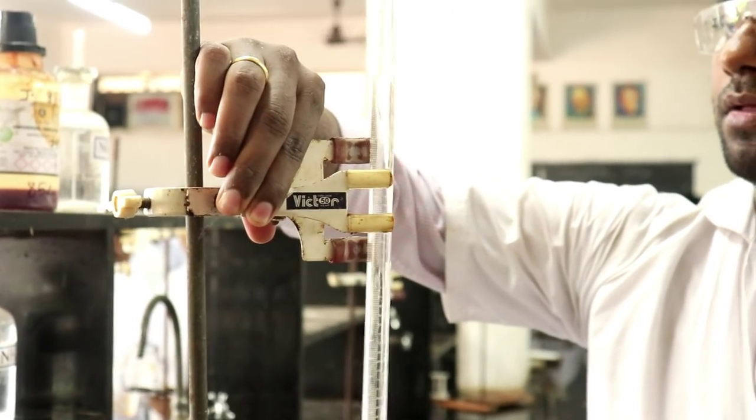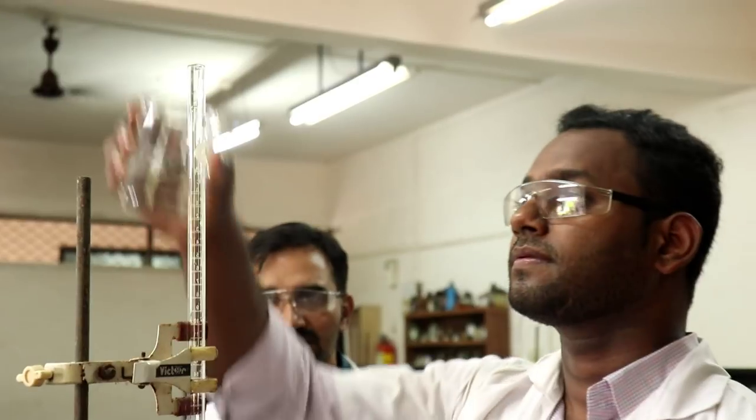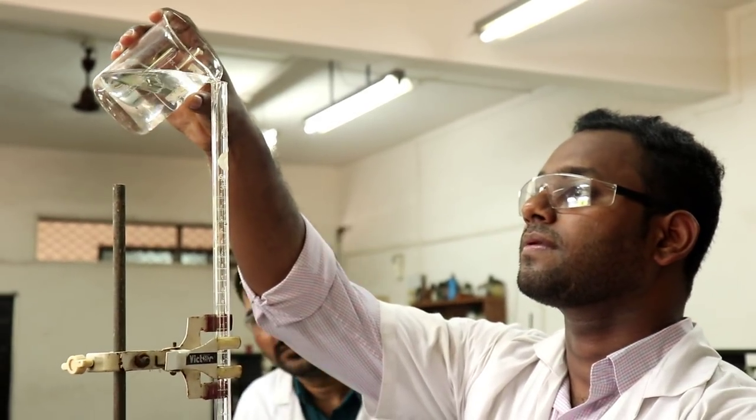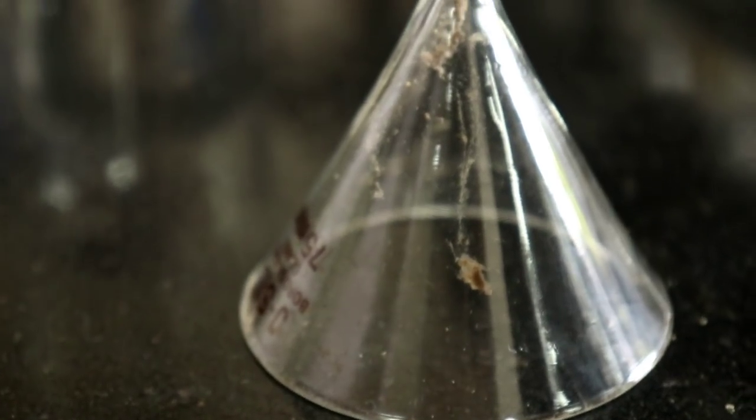Then mount the burette on the clamp. The next step is to fill the burette with a titrant and I recommend not to use a funnel for the same.